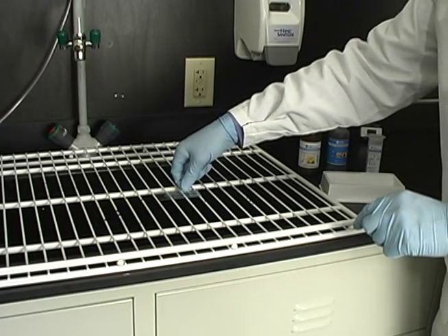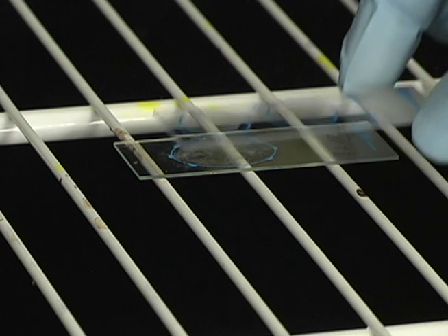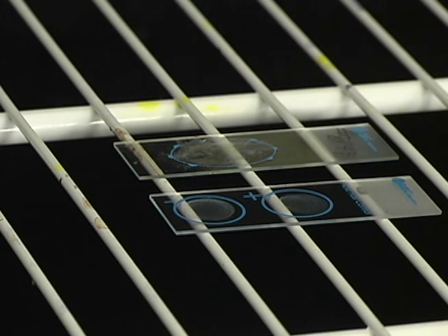To begin, transfer your heat-fixed slides to a staining rack. Quality control is very important for verification of your reagents and microscopy system. Therefore, for quality control purposes, include a control slide with each batch of stained slides if possible.